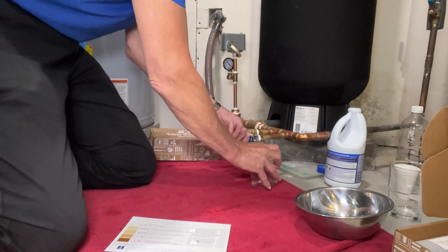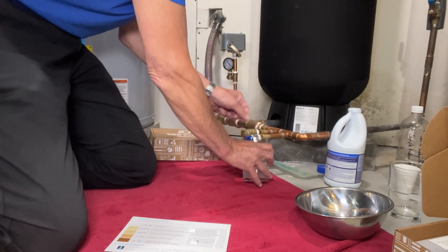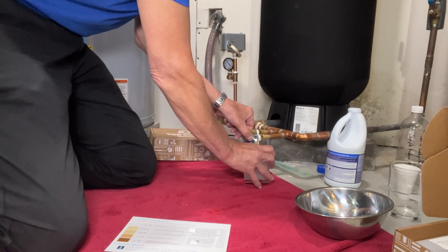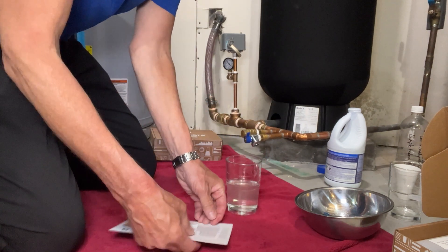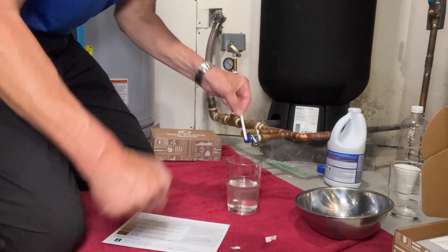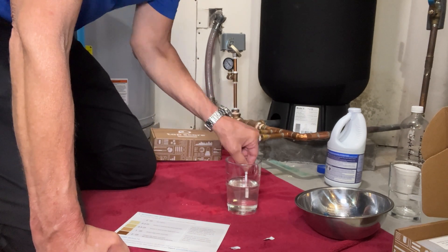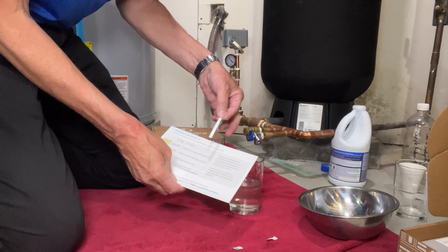This is a fully flushed water sample, so make sure you take it immediately after you've run the water for a while. You can see the test sample tab at the bottom of the strip — push that inside the water sample and hold it in there for 20 seconds, then pull it out.